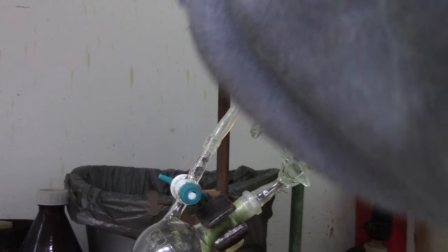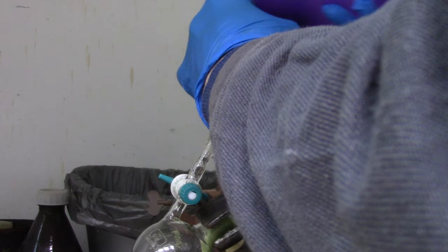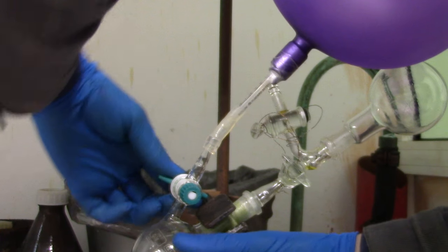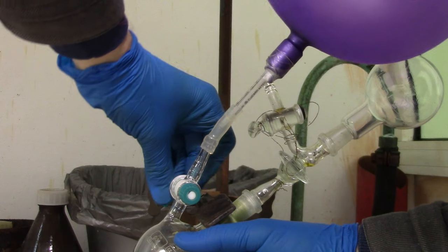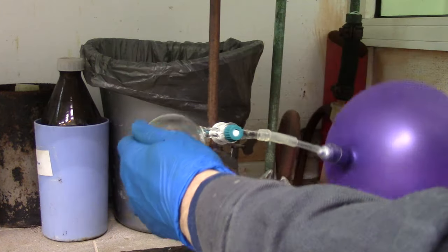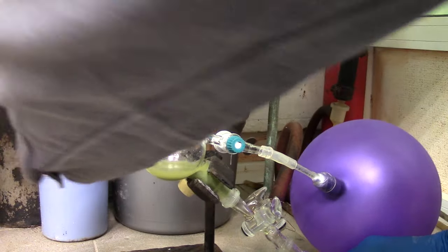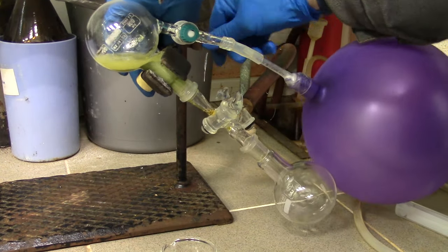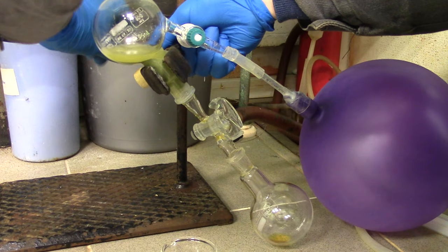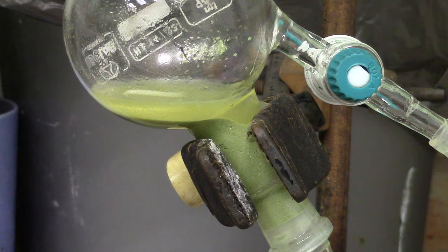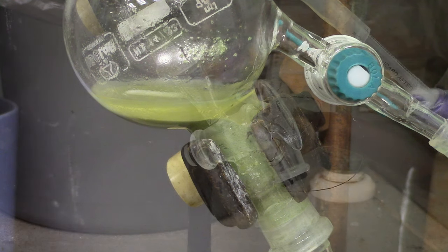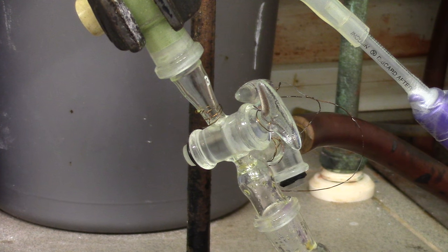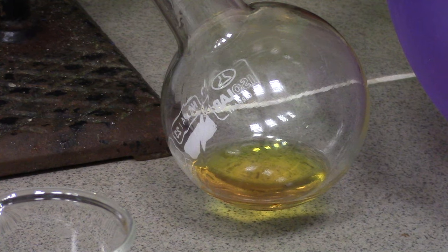Hey, and don't forget to get balloon back! Next step is just a reverse version of previous one. Now just let this pure methanol to come through. Repeat this procedure three times.